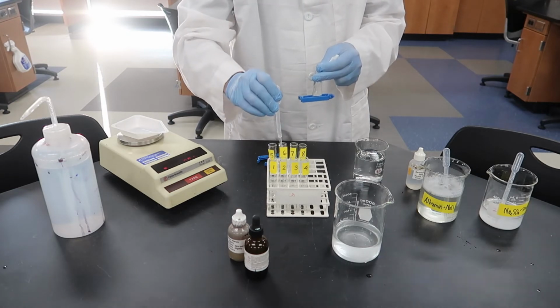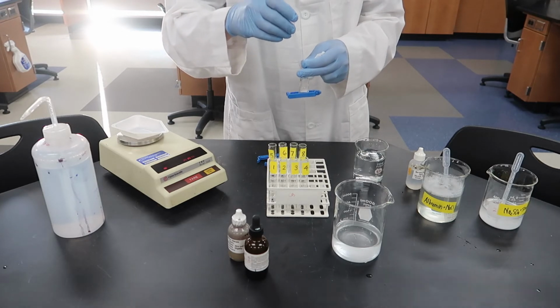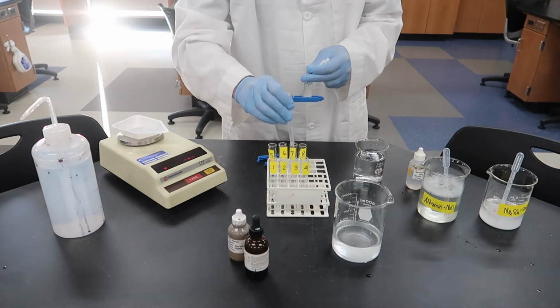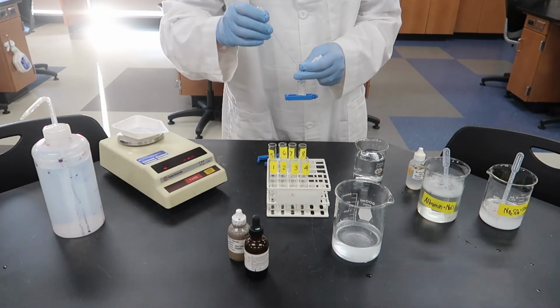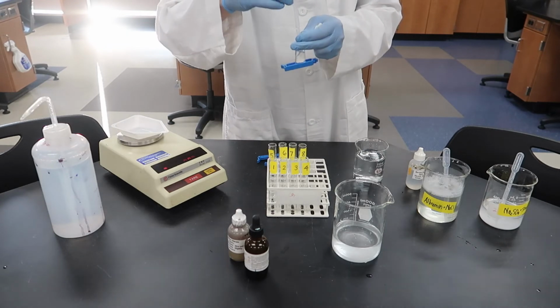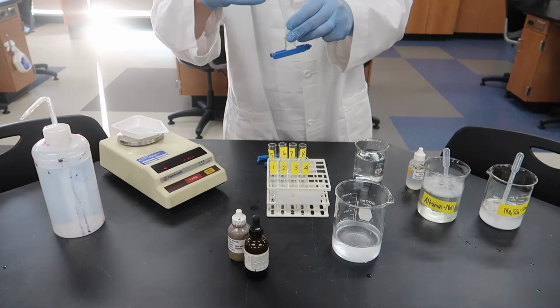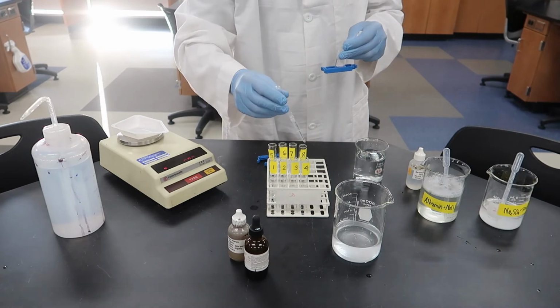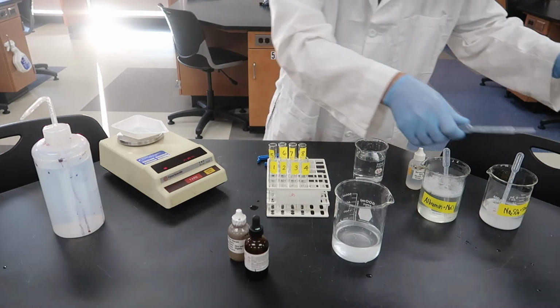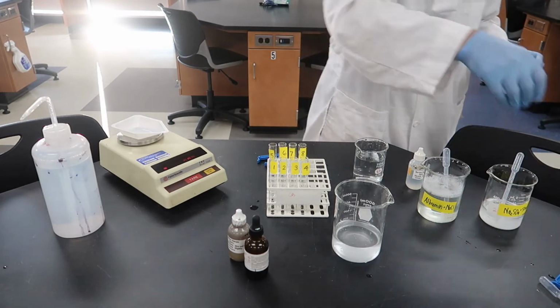Again, this is from the bag to tubes 5, 6, 7, and 8. We already know that the bag contained albumin and sodium chloride because that's what we put in there to begin with. What we're now looking for is if anything new shows up. Okay, and there's our last test tube. We're done with the dialysis tubing bag. We can set that aside. We have our samples from the bag now.